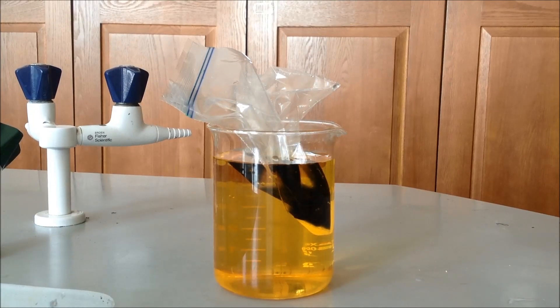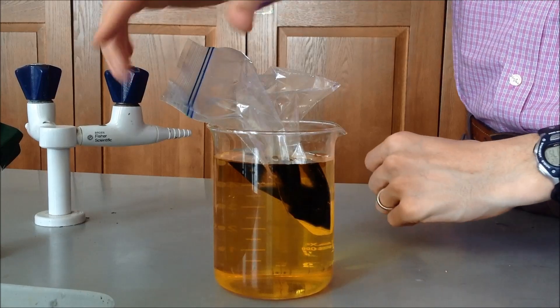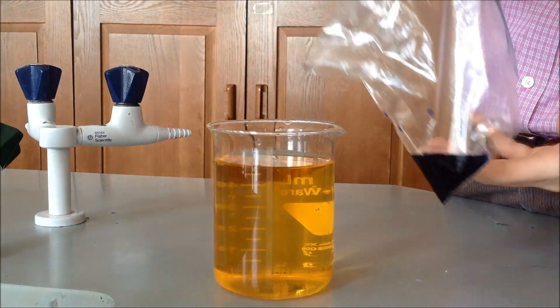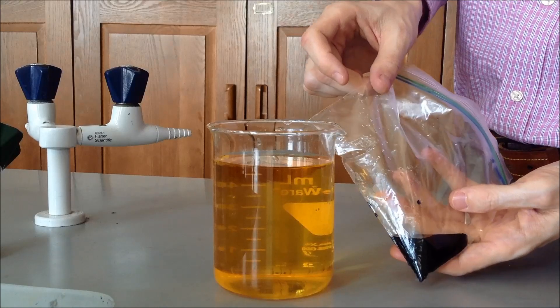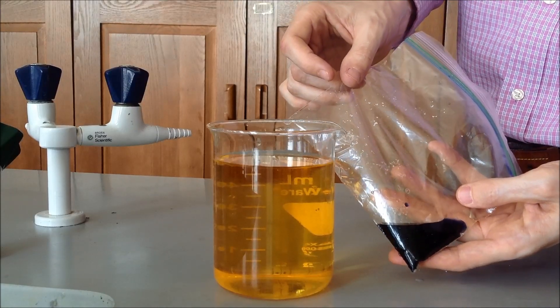So here's the beaker after a couple hours. And so we can see that there has been a change to the color inside of the bag. And that means something, which you'll obviously have to try to figure out.